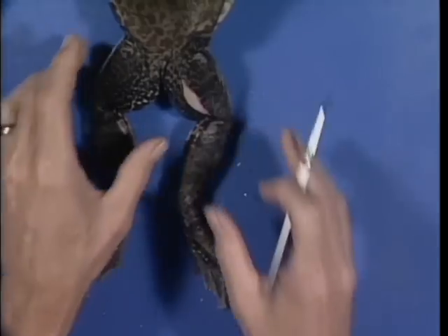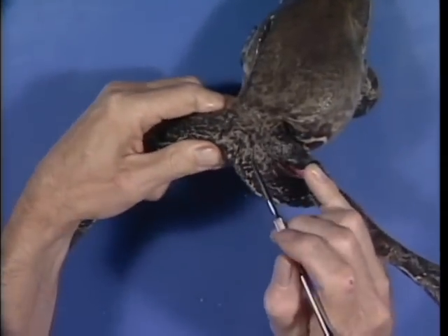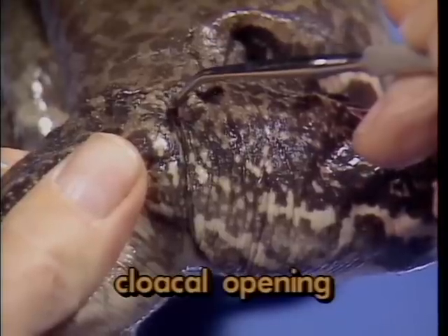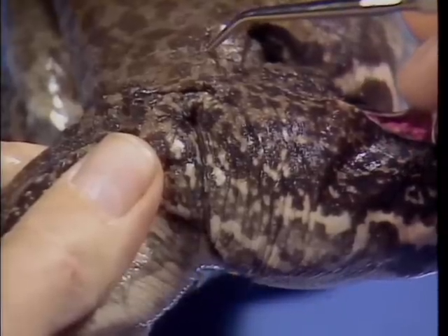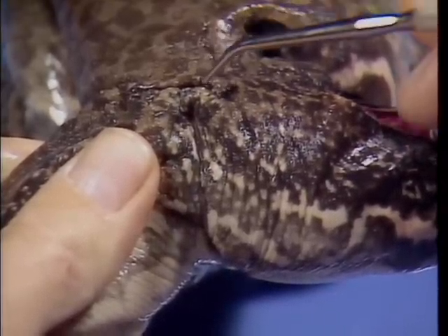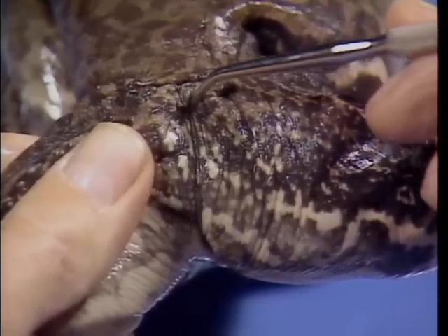Located between the hind legs is a small opening and a chamber within. The opening is the cloacal opening, which leads to the cloacal chamber. Through it will pass urinary products from the kidneys and fecal material from the intestines. During the breeding season, reproductive products, either egg or sperm, are also shed through this opening.